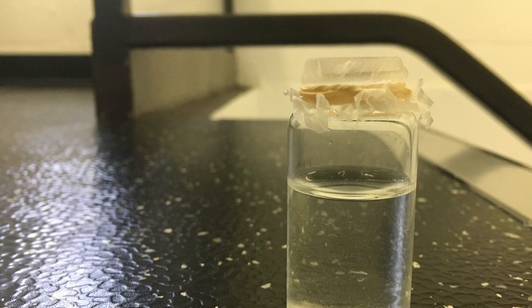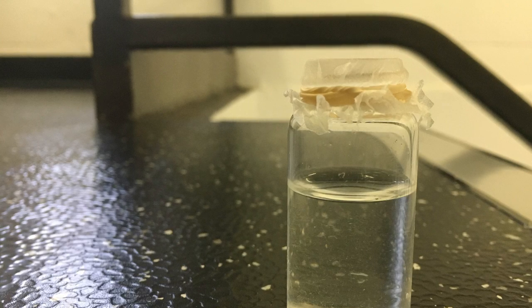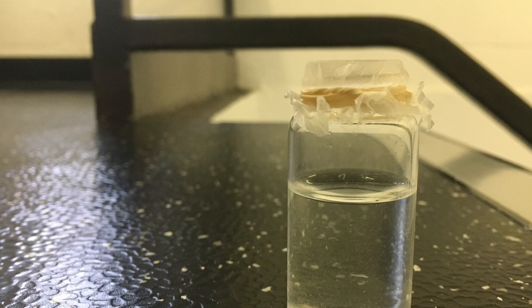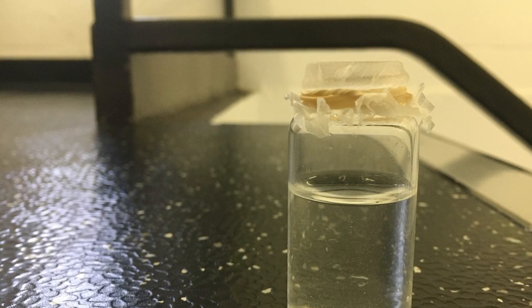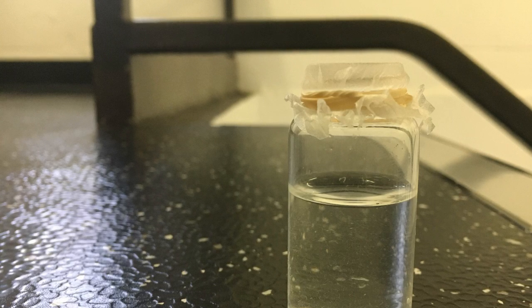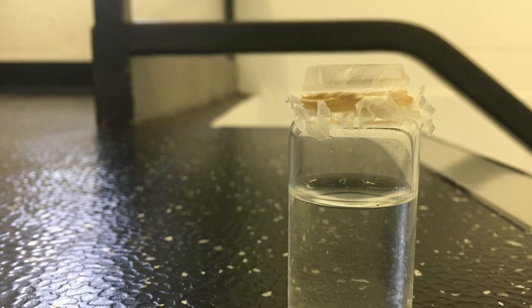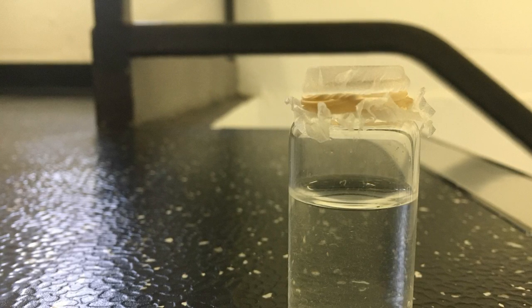I will proceed to describe the crystal growth of my crystal within my own 20 milliliter vial. There is a cluster of white particles that appear to be beginning to form at the bottom of the vial. They appear to be forming one large crystal that can be best described as a geometric variation of a triangle. The crystal is not densely packed, but appears to be a free-floating cloud at the bottom of this 20 milliliter vial.